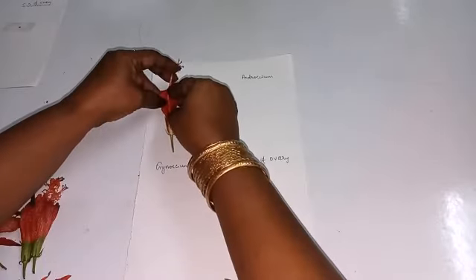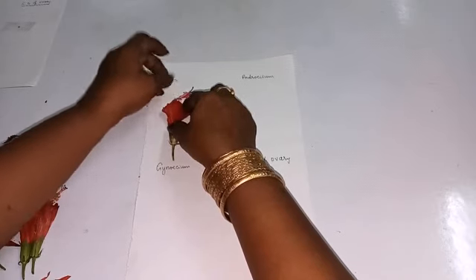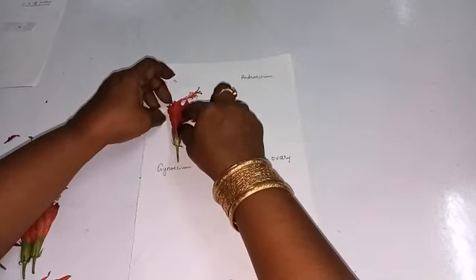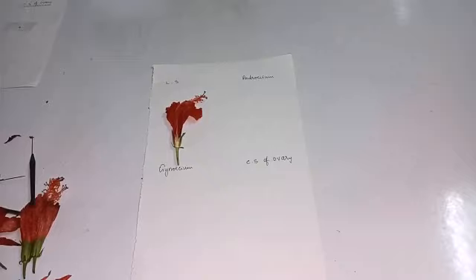You have to keep it here near LS with the sellotape.